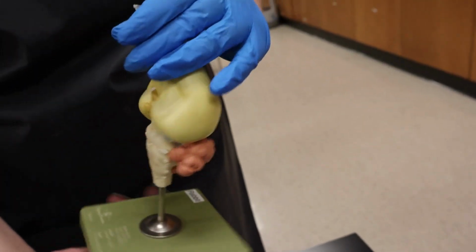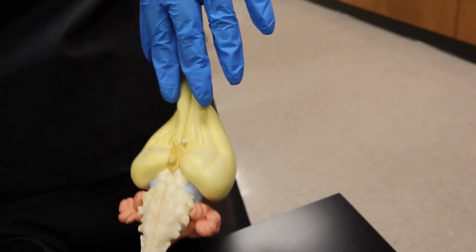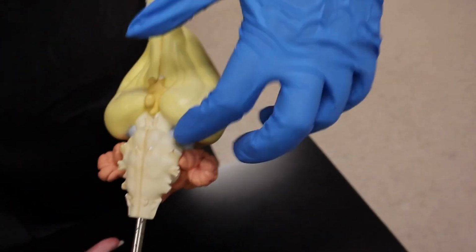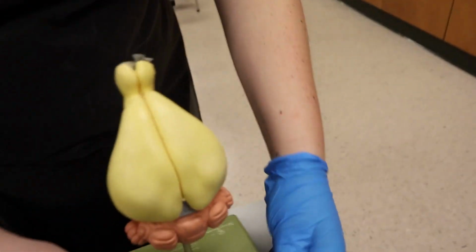Alright, so the anterior part of this yellow cerebrum is actually known for its olfactory bulbs, the smells, which are going to be up here, that help smell, along with how our midbrain, the optic lobes, help sight. So they all have very different functions and are super essential in adaptations to allow rabbits to survive better.